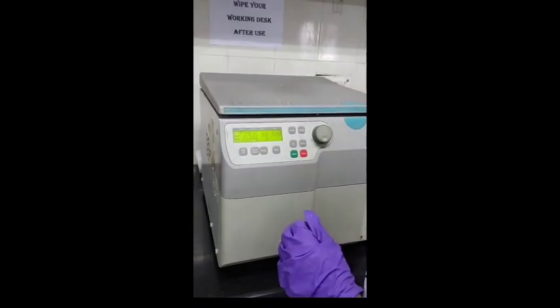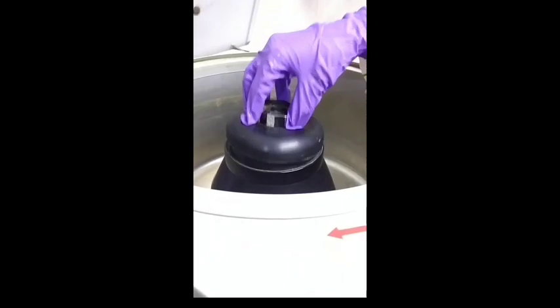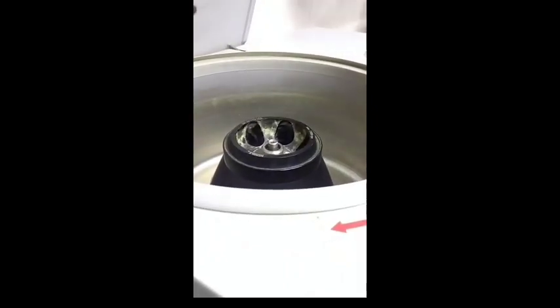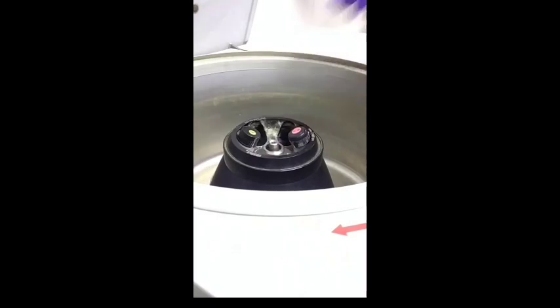Now this liquid has to be centrifuged. For this we are going to use centrifuge machine. Open the lid and place the liquid into the compartment of the centrifuge machine.